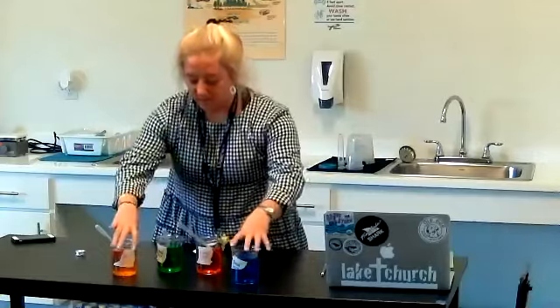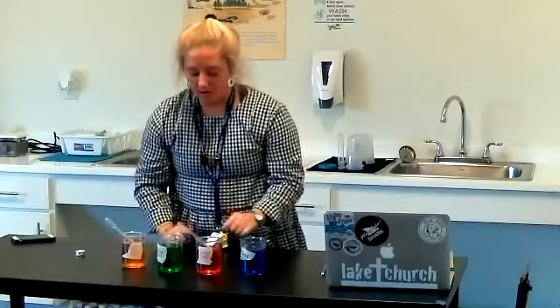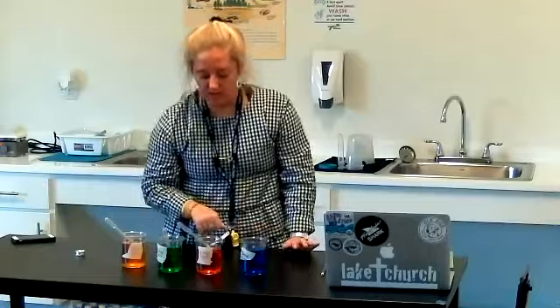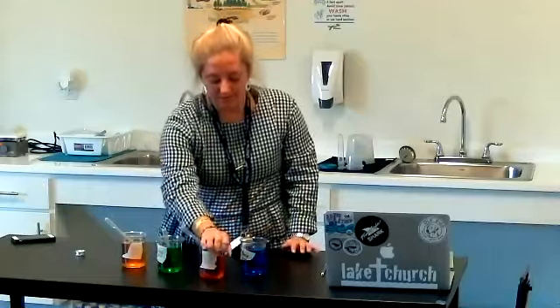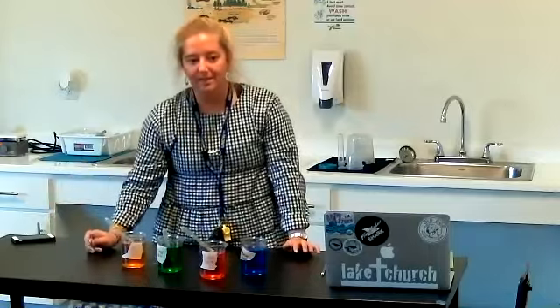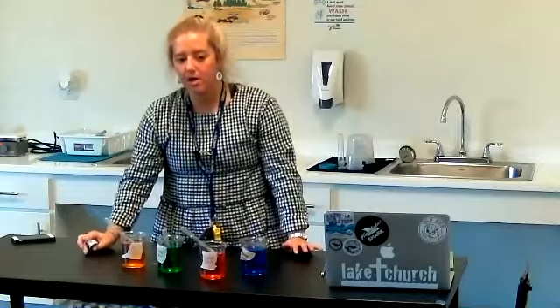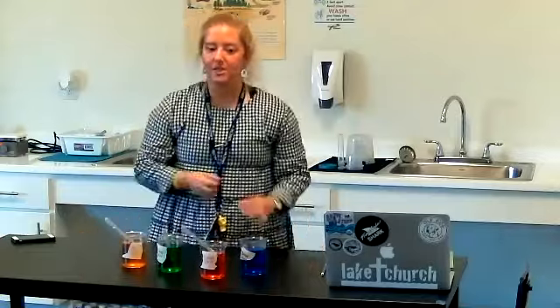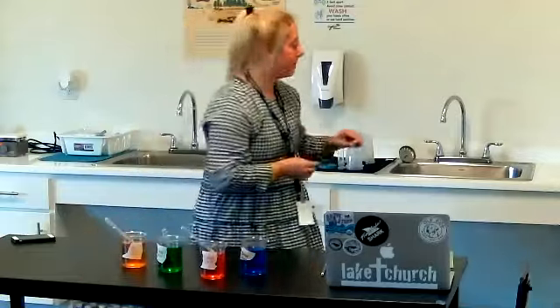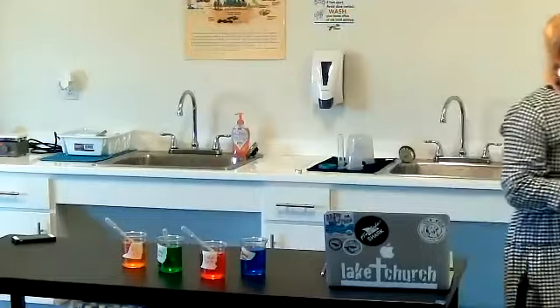If I ask you another question, like which one is more dense — my green or my red — you would tell me that the red is more dense because it has more salt. In a couple of lectures, you're going to see how these density differences, along with the density difference in temperature and water, lead to the currents we see in our ocean. Have a great day, guys. Use this lab to complete your lab sheet.